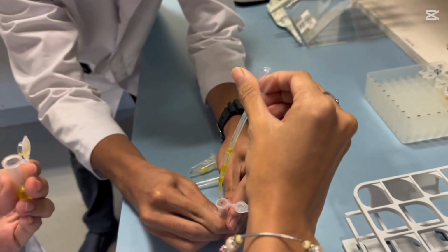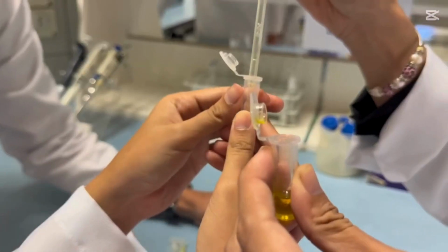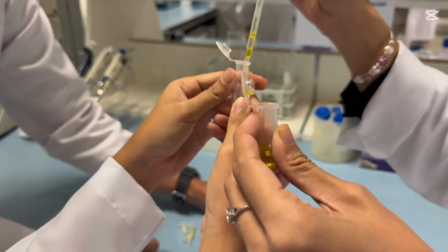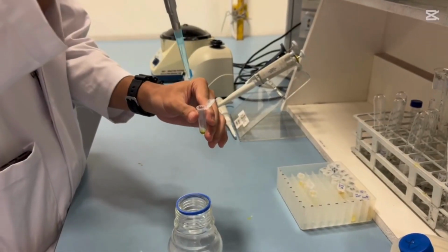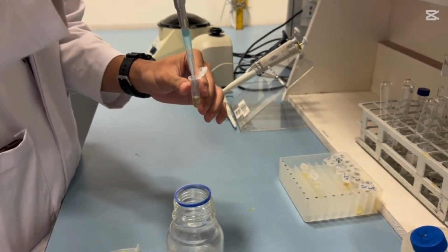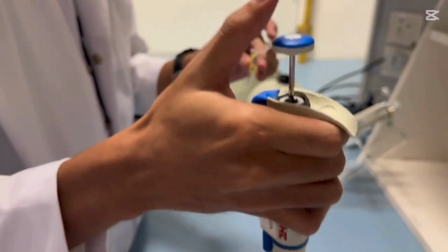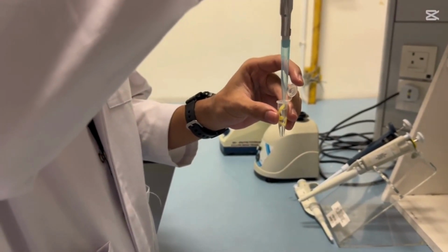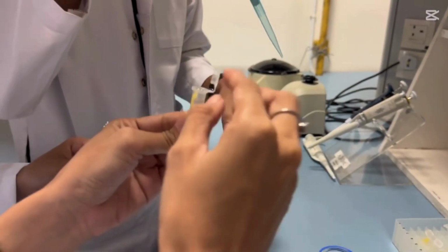Number 4, set 1, solubility in a polar solvent: add about 1.0 ml of water to each microcentrifuge tube. Cap the tube and shake to mix. Record your observations in the table below. Number 5, the last one, is set 2, solubility in a non-polar solvent: add 0.5 ml toluene, C7H8, to each sample. Cap the tubes and shake to mix. Record your observation in the table below.